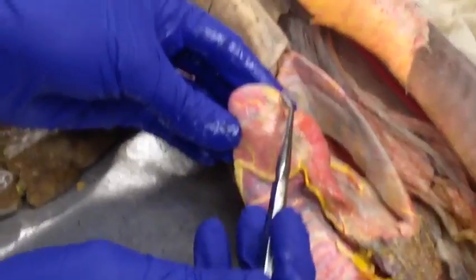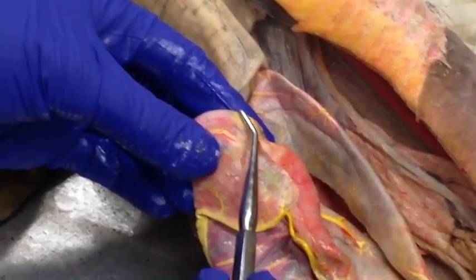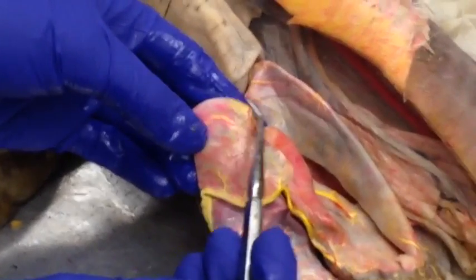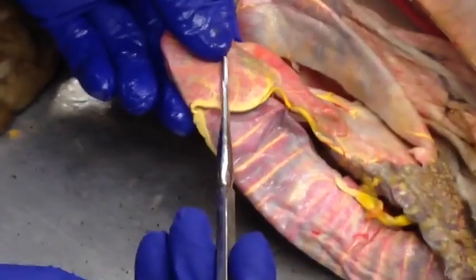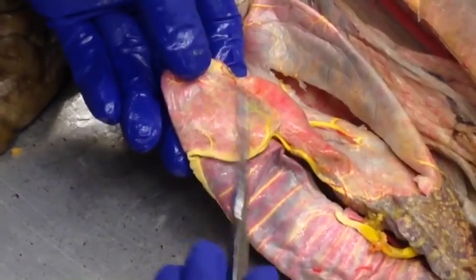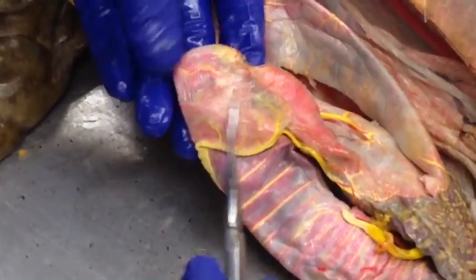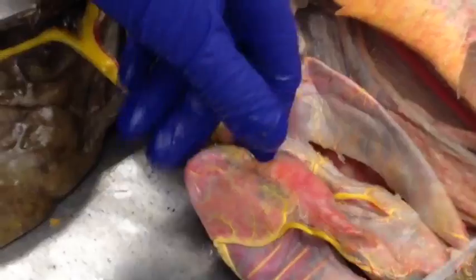Over this tiny little curve is the duodenum, right? And the duodenum triggers the release of lipase, right? Yeah. And then in the curve of it is the pancreas. Oh. Well, yeah, I think it's the pancreas that triggers the release of lipase. Sorry. The pancreas triggers the release of lipase, and then here's the duodenum. So the pancreas sits in the curve of the duodenum.